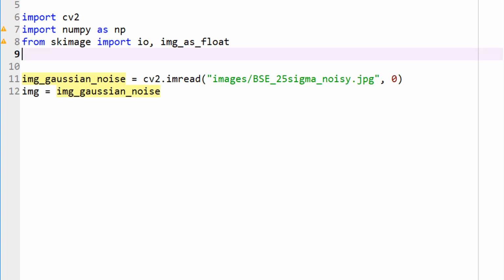So now let's go ahead and run this just to make sure everything is working fine. So that's okay. So far we just imported the image. We just loaded the NumPy array corresponding to this image. Okay, so now how do we apply the bilateral filter?